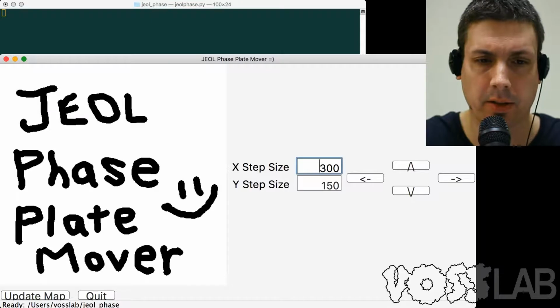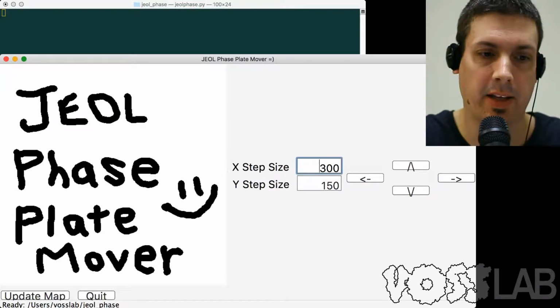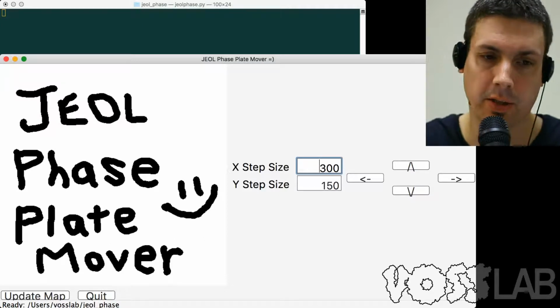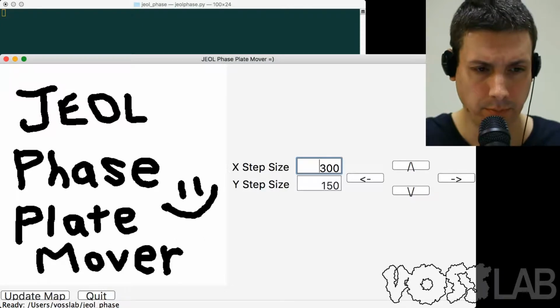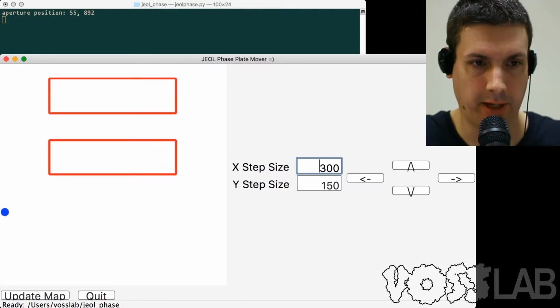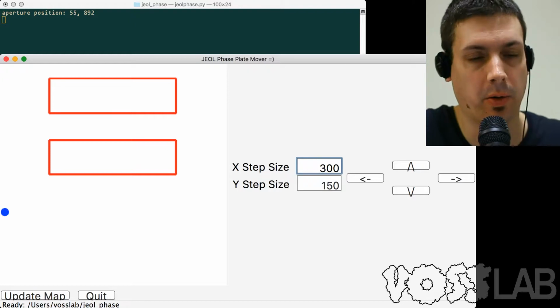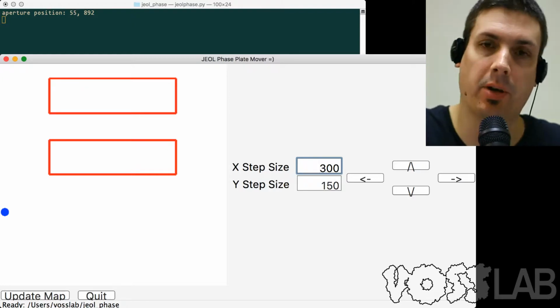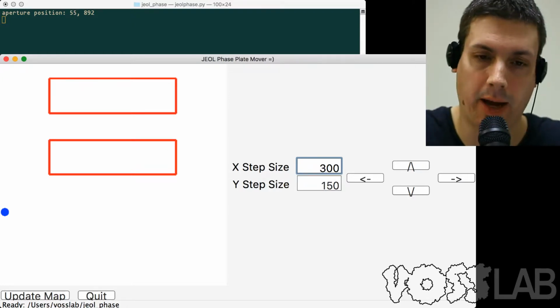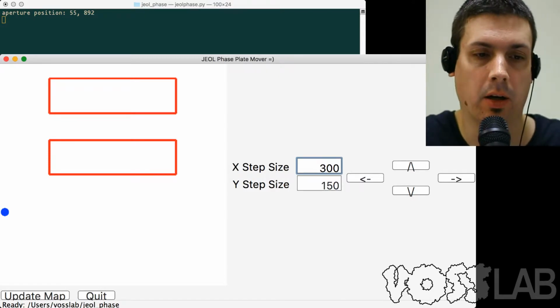One of the things is it starts off the same, but I was able to clean up a lot of the interface because we didn't need a lot of the Xmin and Xmax. I've moved that to a configuration file, and I'll talk about that in a minute. But if we take a look at when we update the map, we see that we now have 2 slits, which is how it was set up on the microscope. The original one had 1 slit, and we have 2 slits per aperture, and 2 aperture holes, so we'll have to have a separate configuration file for each.